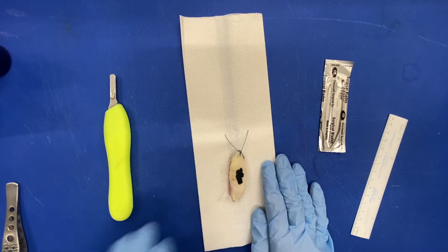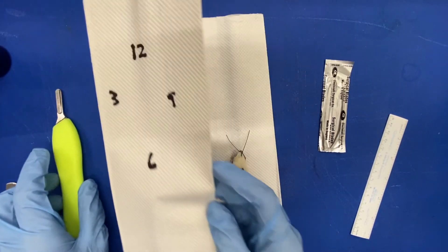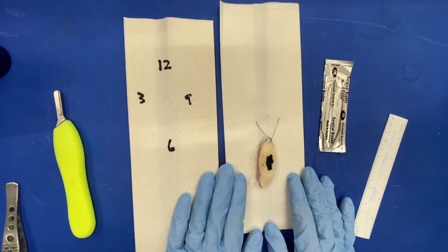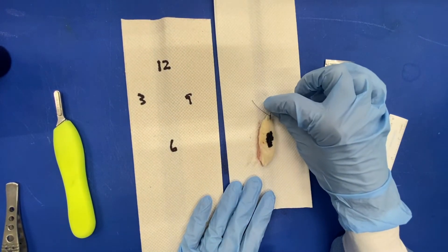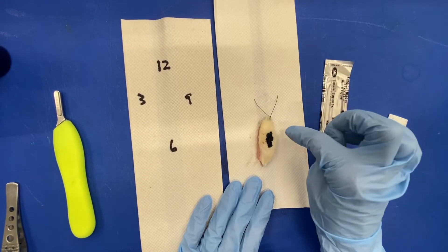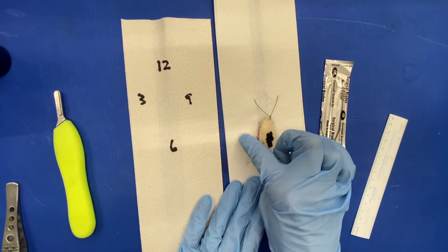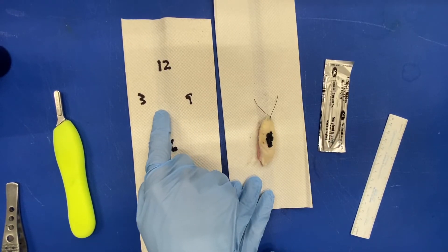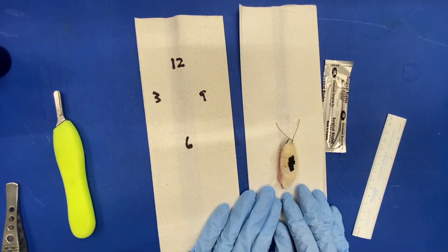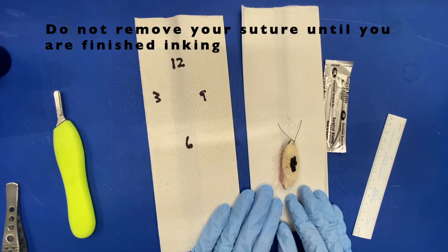Now turn the specimen over. I have a pre-labeled diagram here for myself. This was designated as 12 o'clock, so in the clock face you have 12, 3, 6, and 9. I'm going to turn it over and make sure I'm maintaining my orientation. Another thing to keep in mind: you do not want to remove the suture until you have completed your inking.